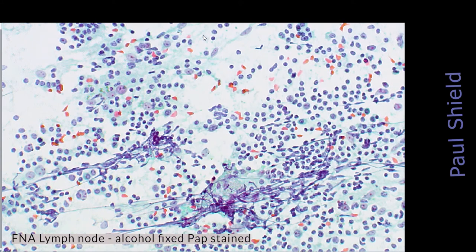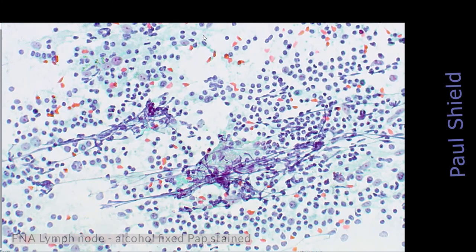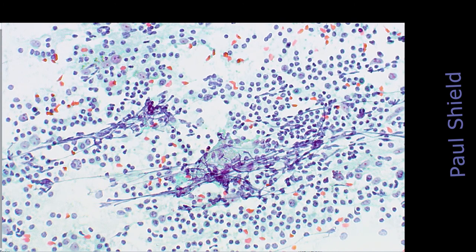This is the pap stain slide. Same thing, you can see a really dispersed population. That stringy material is just smashed nuclei, so that's the DNA material that spreads out and then gets stained. Lymphocytes are pretty fragile cells, they tend to do that quite a bit.